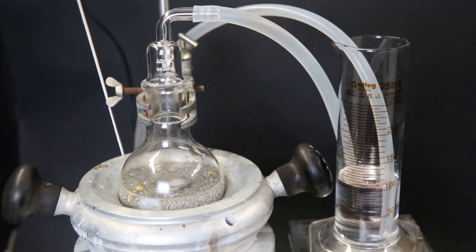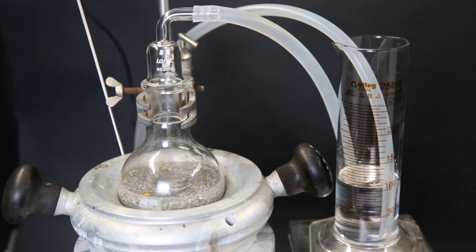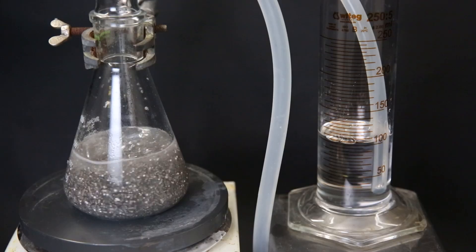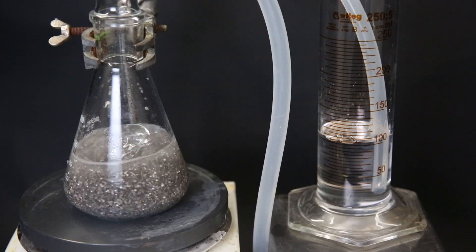After a while it seems to be able to hold up the stirring and we are producing some bubbles, which is the hydrogen gas escaping from the mixture. But after a while the stirring is again blocked by the weight. So I got tired of it and just poured everything into an Erlenmeyer flask, which works a lot better. We can see in the trap that the hydrogen production is going nicely.